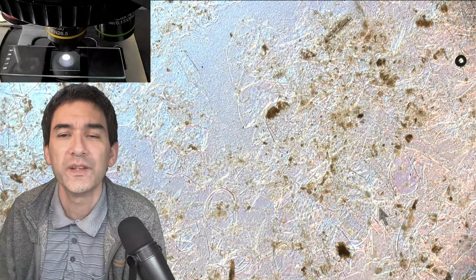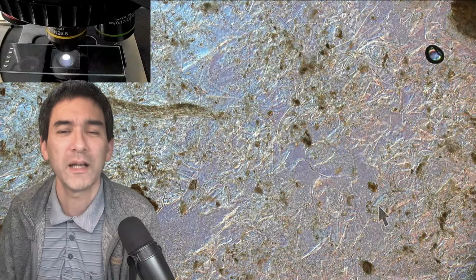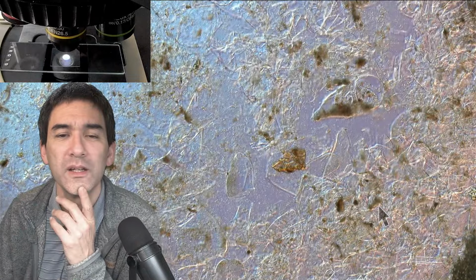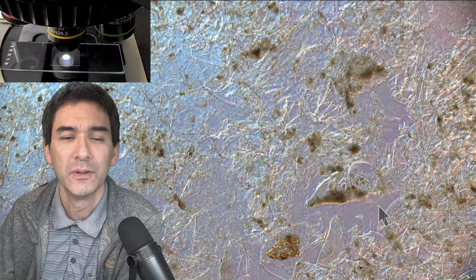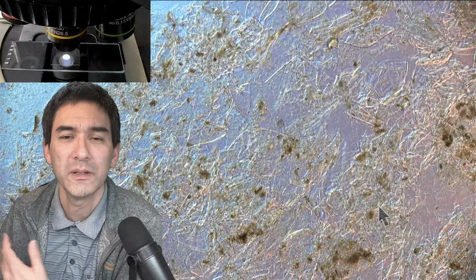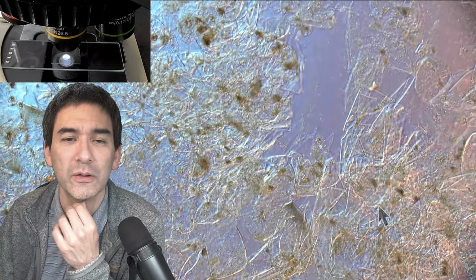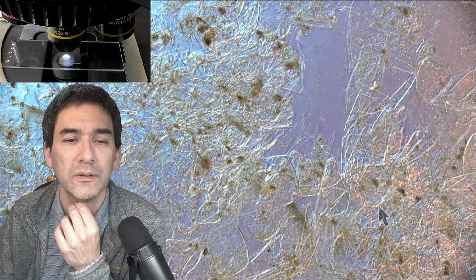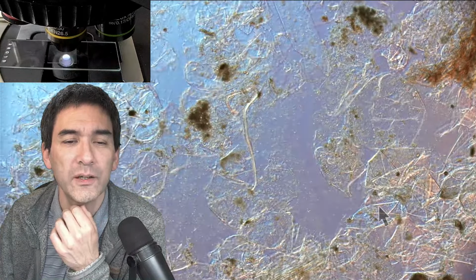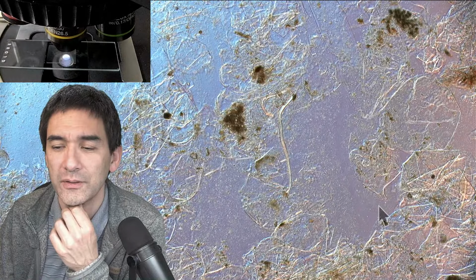We find all sorts of things here, but it doesn't look particularly nice. It would be cool if there were some kind of beautiful thing or something moving. It's not always like that, but I still like to do these things sometimes, because it's a little bit like chasing and hunting down some structures that look familiar. A little bit disappointing, because usually xylem is quite easy to find. I wonder what these long things here are. These are also some kind of plant fibers.